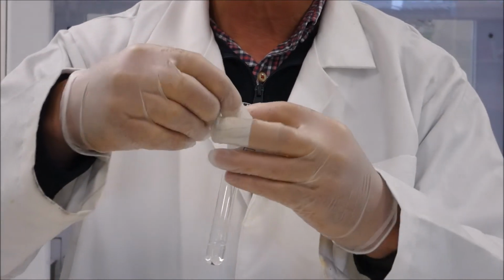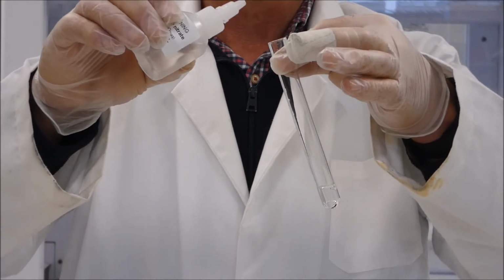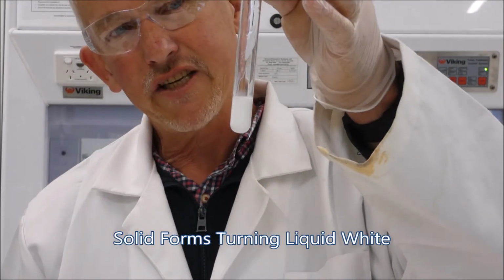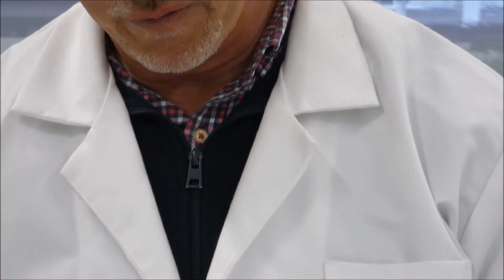We're then going to take some silver nitrate. So we've got silver nitrate there. And silver nitrate is a salt which contains silver and obviously nitrogen and oxygen. And we put it in there, you immediately see a reaction occurring. Before you could see that through that tube, now you can't. And that's because there's a solid forming in the tube.